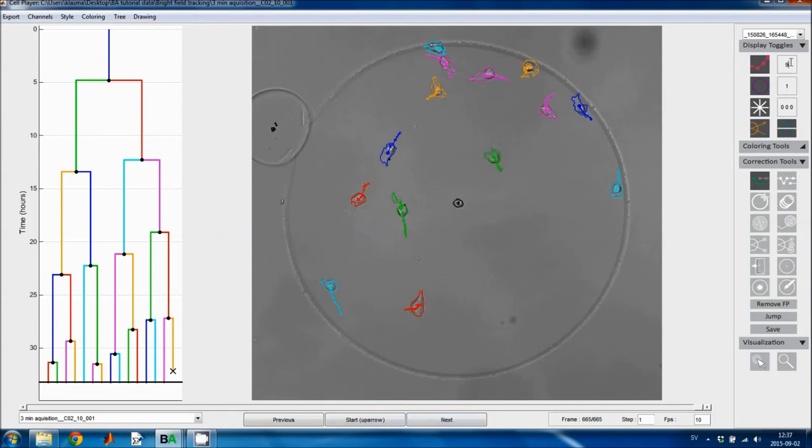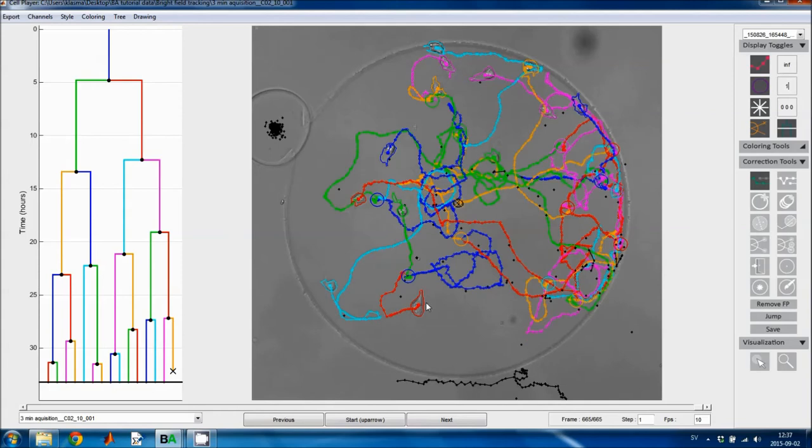If we plot the full tracks, we see that we have, I can turn the false positives off, that we have cell division events marked with circles and cell death events marked with X's. If you press this toggle button, you toggle the plotting of such events on and off. And then this toggle button just turns the display of this horizontal line in the lineage tree on and off. That can be useful if you want to save a picture of the lineage tree.